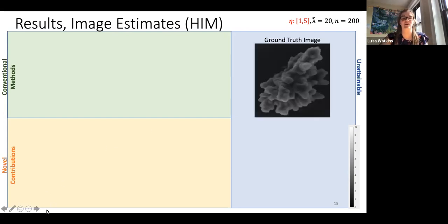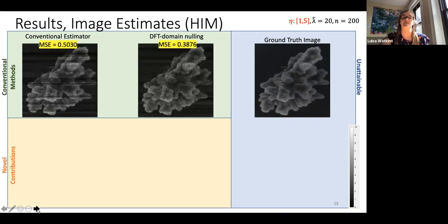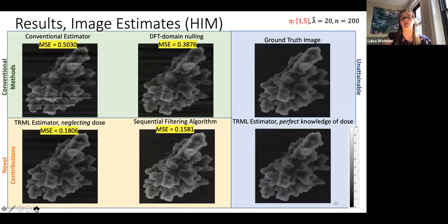I've shown this multiple times, that we have our ground truth image. This is the conventional estimated image. This is the DFT domain nulling. This is the TRML neglecting the dose. So this is what I had shown on that plot. This is the sequential filtering algorithm. So if you see, we're able to do even better. And then the unattainable is this perfect knowledge of the dose, where there's still some error, but knowing the dose, we're able to do a much better job. And the idea here is that I'm trying to get as close to here as possible.